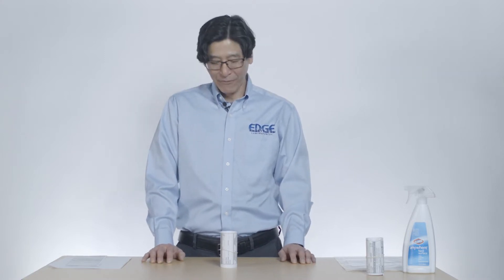Hello, my name is Hiro Yamamoto and I'm from Edge Analytical Laboratories. I'm here today to give you a demonstration on how to grab a bacteria sample for analysis.